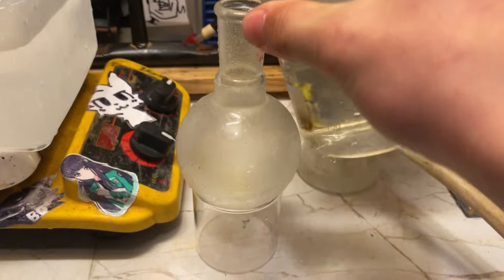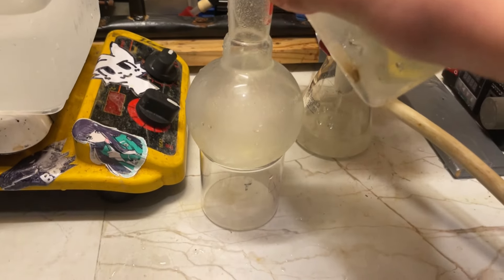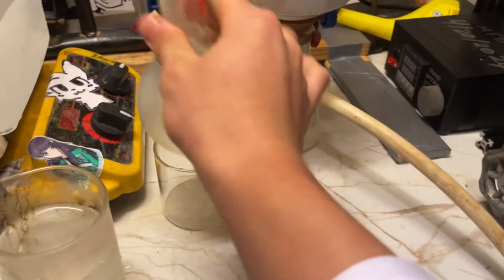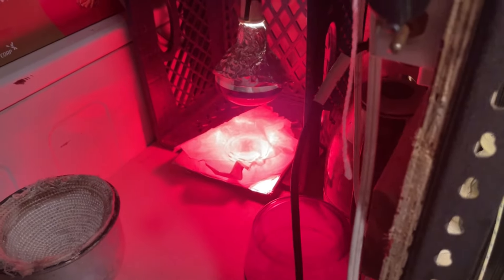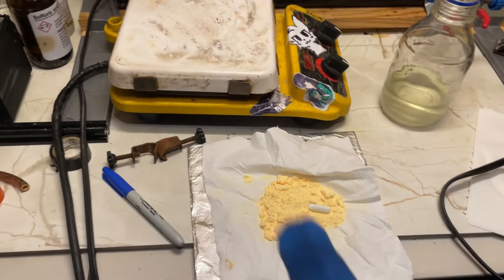Still dropping. Nice. There we go, that's better. I'm trying to stir it a bit. So there we have it. Filter this off. Ice bath water. Nice tan powder. We got it dry now in the heat lamp, so we just wait for that to dry to a constant weight, and we'll be good. Okay, it's been a few days, so this is definitely dry.